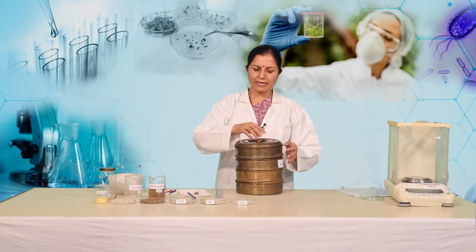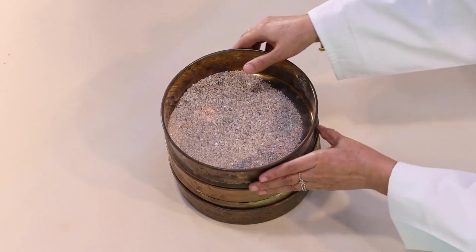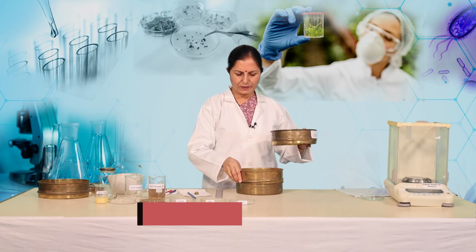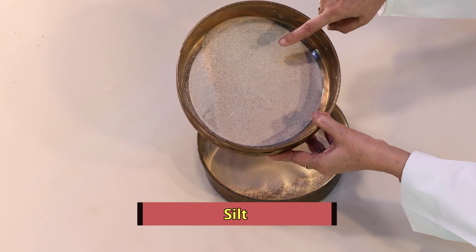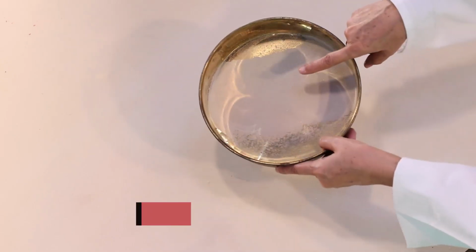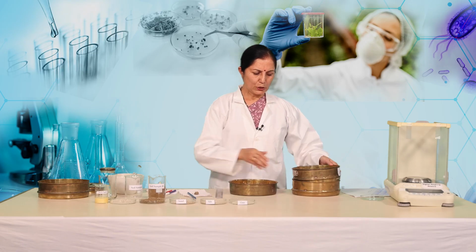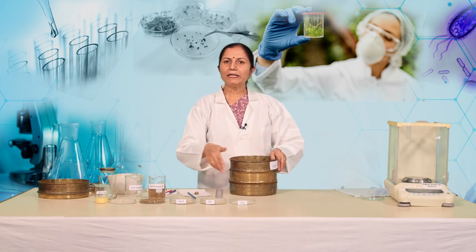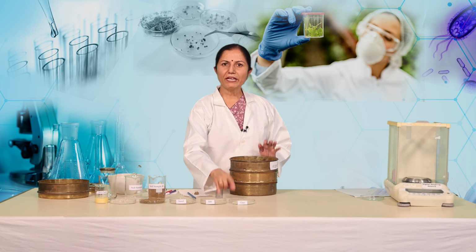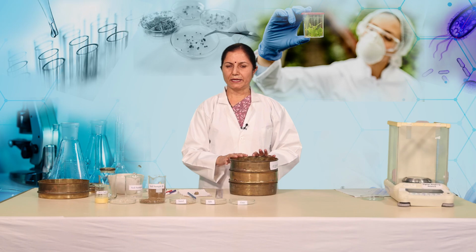and collect the soil fraction in 3 different petri dishes. The sample that will be collected in this layer will be sand. The second layer will have the silt, and the bottommost part will have the clay, that is the smallest particle size. We can collect them in 3 different petri dishes and we can weigh them. The total weight of the 3 fractions should be equal to the weight of the total soil sample taken.